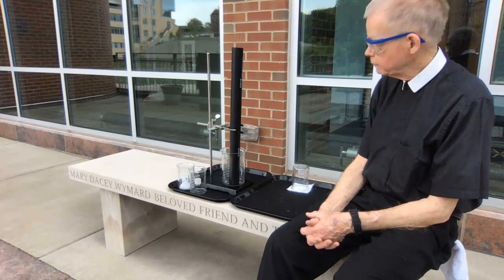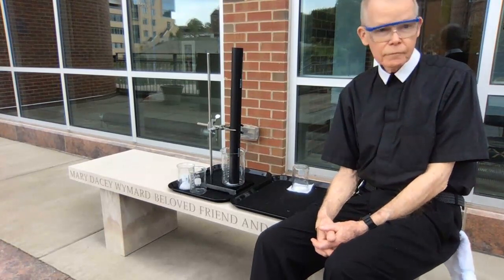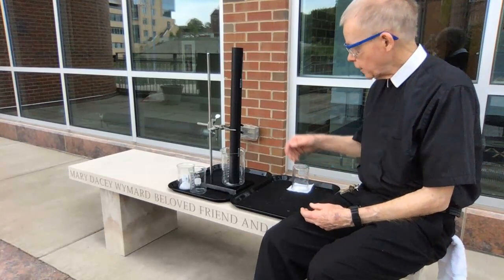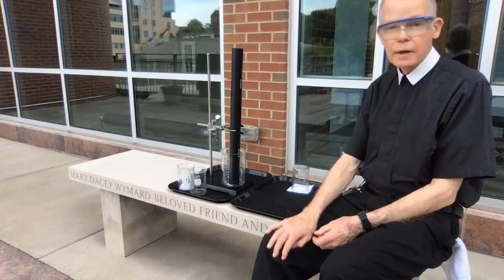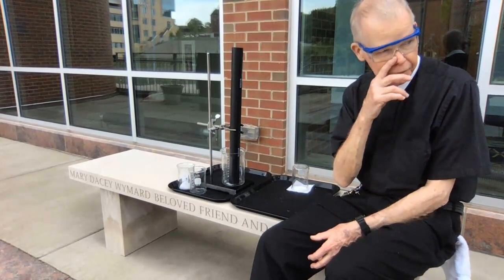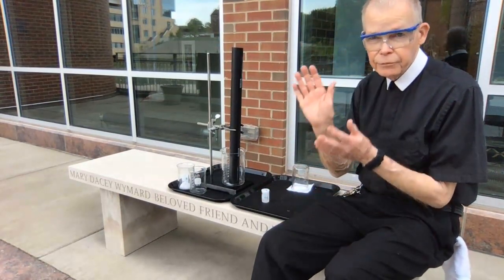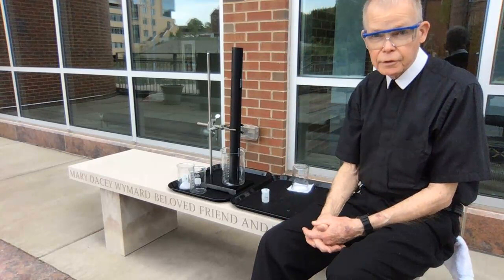I didn't shake this one up. Pretty good. Fortunately, they're landing slightly downwind of me. That's good. I'll lift up the tube, dump out the contents again, and then we'll try the third one. I'm going to try to estimate by standing away from this roughly how high the canister goes. That was 1.5 grams. This will be our final one, the 2 gram sample, and I'll probably even try to aim the computer up a little bit so maybe we get a little bit of the trajectory of the canister.